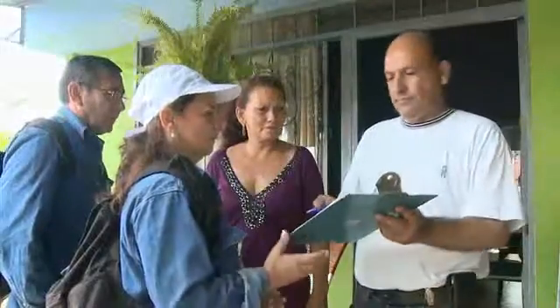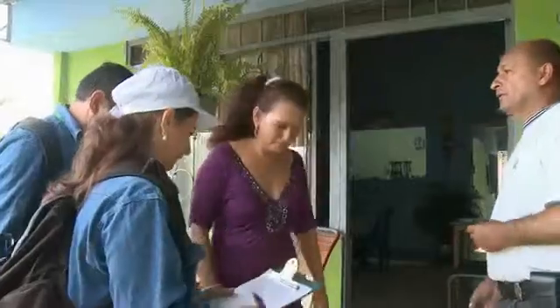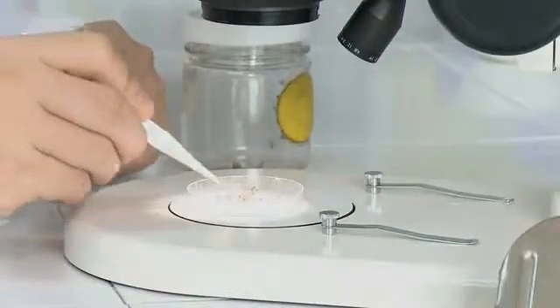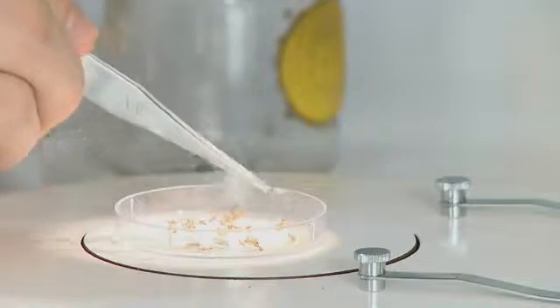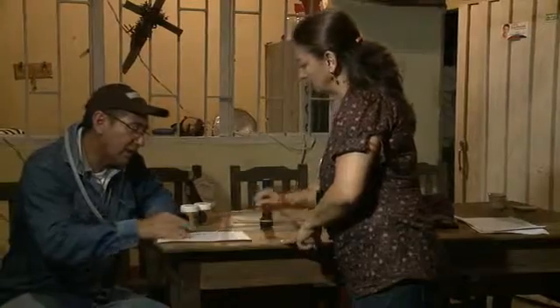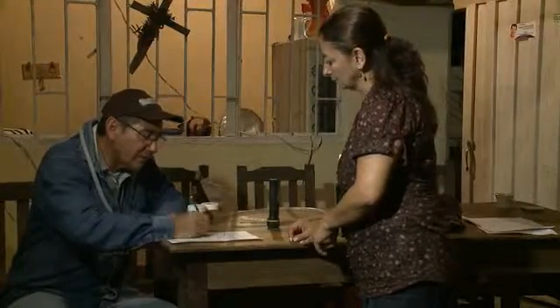Adult mosquito collections are usually performed by a team of trained people working closely with communities, health workers, and laboratory staff involved in the prevention and control of mosquito-borne diseases. Make sure the mosquito collectors have access to anti-malarial medication, including prophylaxis, and access to health services in the unlikely event that they become ill, in addition to signing a consent form.